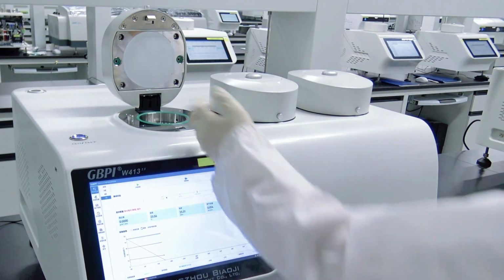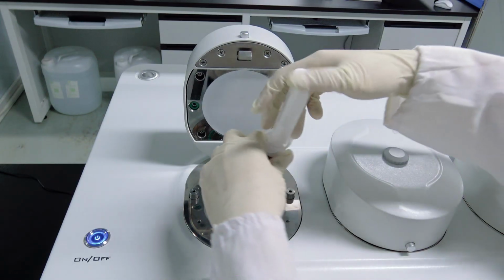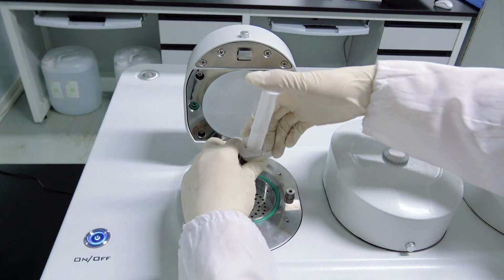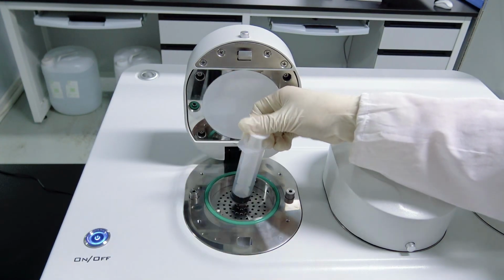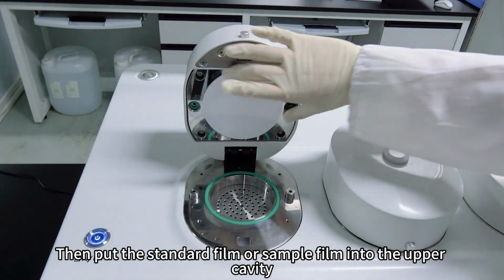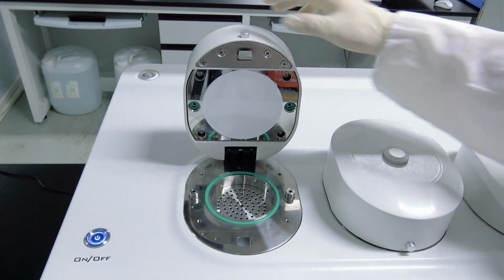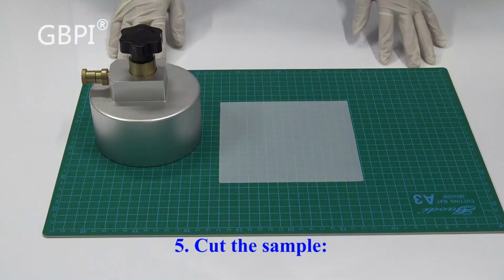Conventional thin film testing. Open the cavity cover. Inject 30 milliliters of distilled water into the lower chamber. Then put the standard film or sample film into the upper cavity. Now for a new sample.